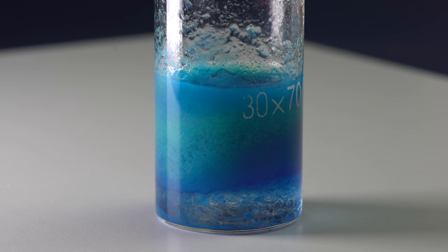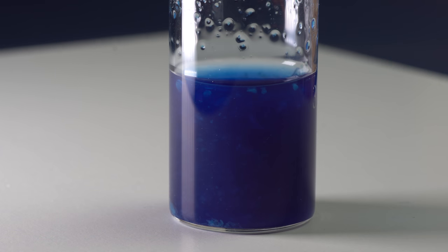Also, if you mix blue copper hydroxide and glycerol, the solution will turn bright blue due to the formation of copper glycerate, which is also a qualitative reaction for checking polyhydric alcohols.